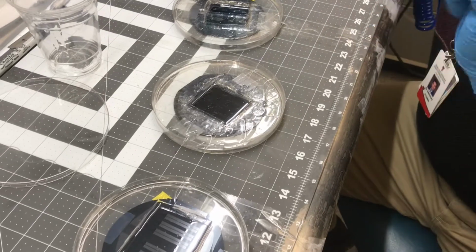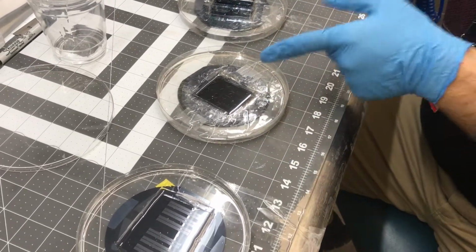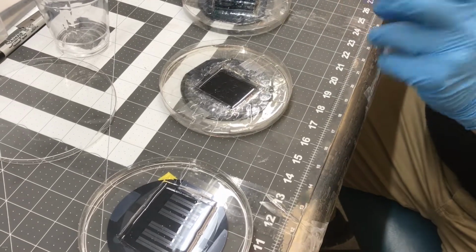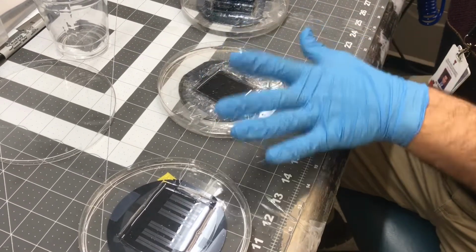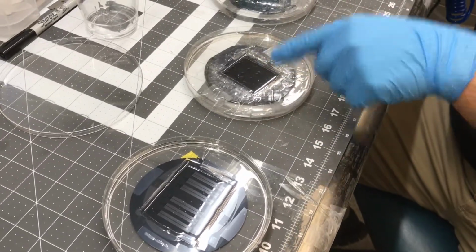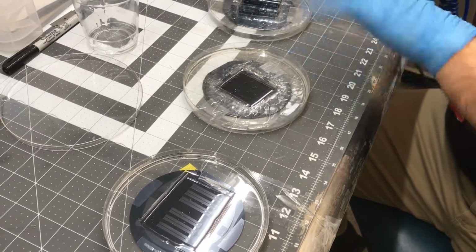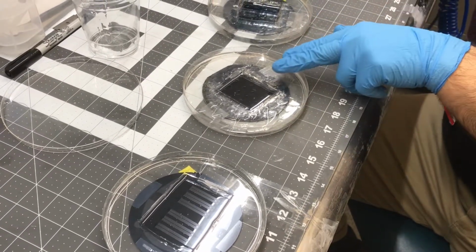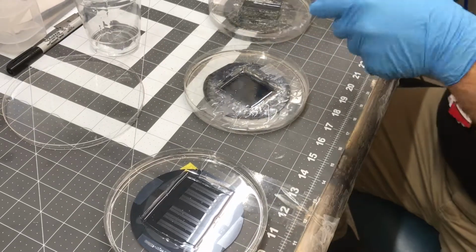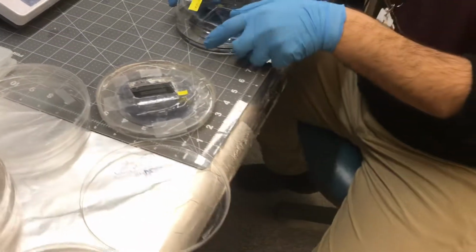Two things are important. If you add very slowly, more bubbles are created, so that's the reason you should do it fast. The second important thing: you should not keep this outside for too much time, for two reasons. The first reason is that if you keep it outside, the PDMS and the curing reagent make a semi-solid PDMS, which is not good for your chip. The other reason is that more bubbles go inside. For this reason, immediately after pouring, you close the lids.